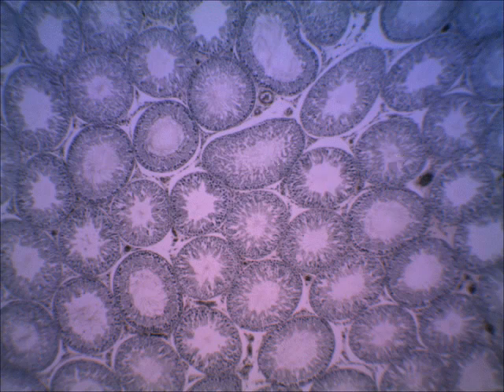Sperm cells are actually produced through mitotic and meiotic cell division that is in this epithelium. It's a very thick layer of cells that lines each seminiferous tubule, and that epithelium is known as the germinal epithelium. In just a moment, we'll see this on a higher power, and we'll see a little bit more detail on these cells that produce the sperm cells.